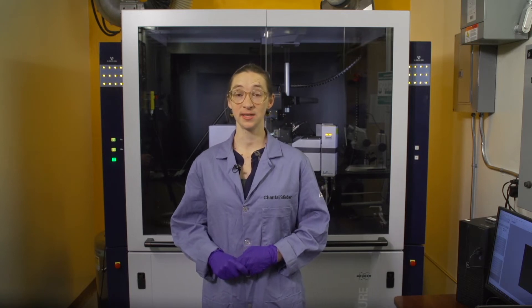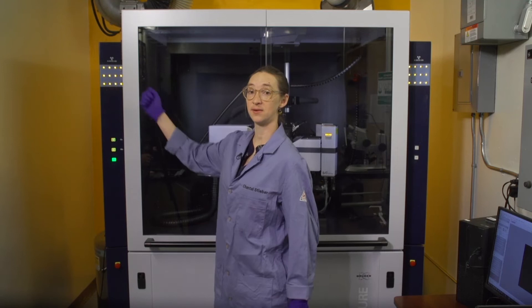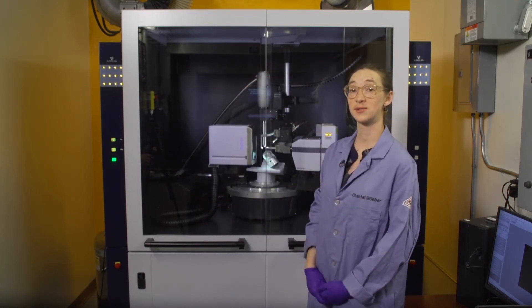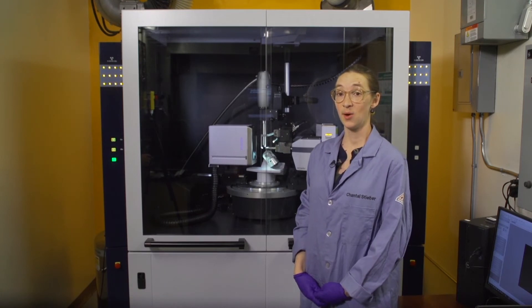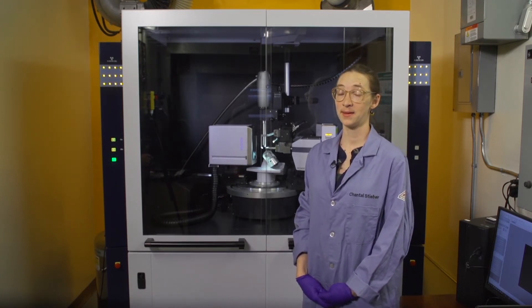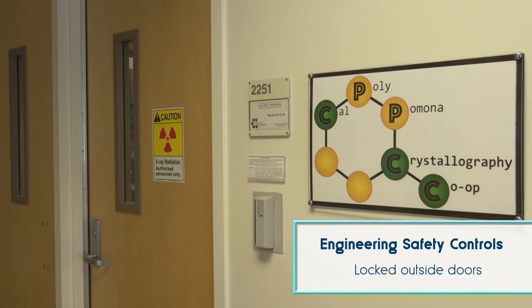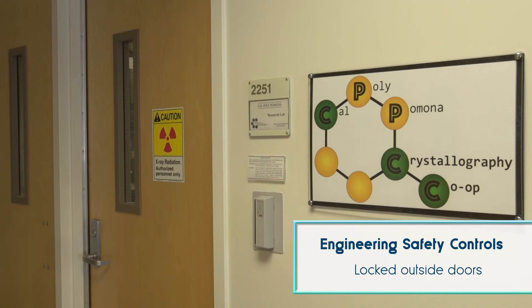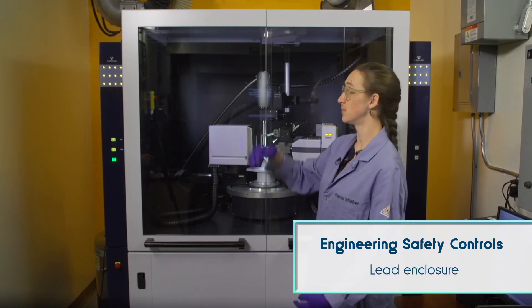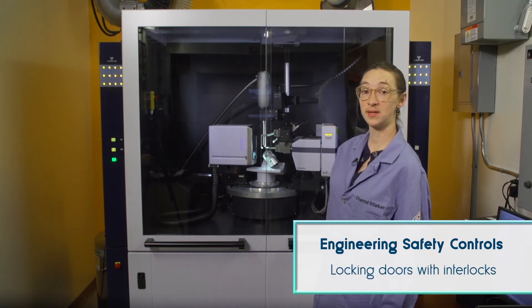On the sides of the x-ray diffractometer and inside the housing are lights to alert you when x-rays are being produced. When x-rays are being generated, the lights are on. Examples of engineering safety controls include locked outside doors that limit access to the room housing the diffractometer, a lead enclosure around the instrument, and locking doors with interlocks.